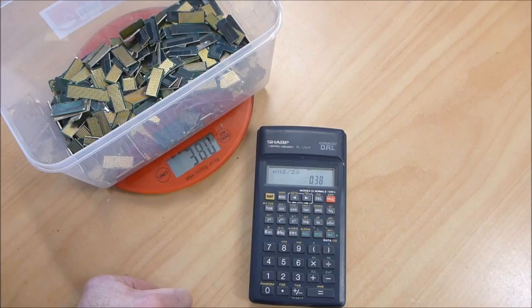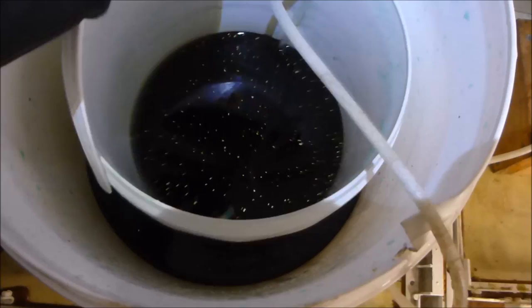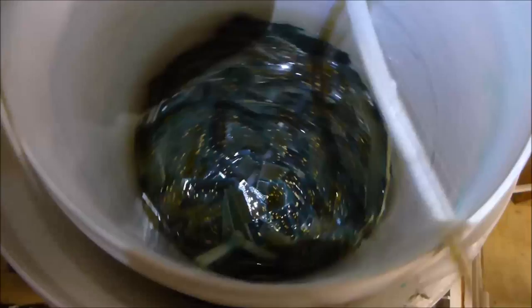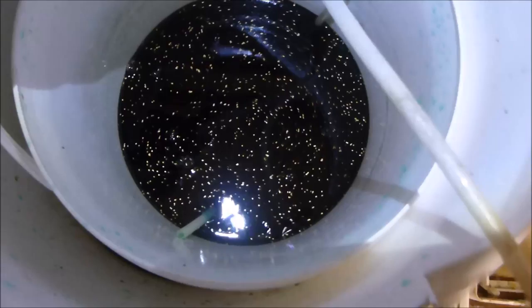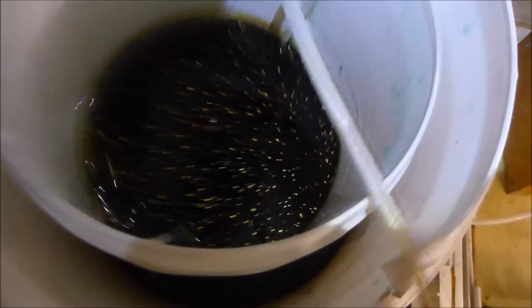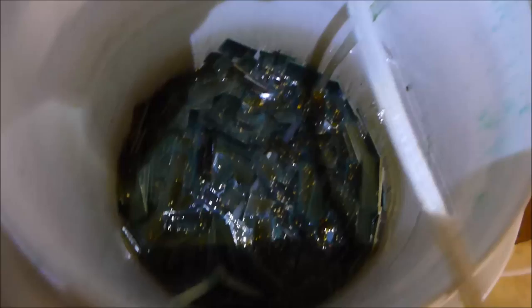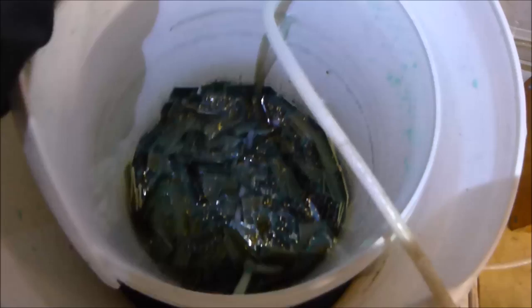I've had the bottoms from the pinless processors sitting in an AP solution bubbling away for a few days. It appears that most of them have lost all of their foils. As you guys will see, quite a lot of nice little bits of gold there. Those little foils do indeed come off as foils, so they are obviously relatively thick. I'm going to get this stuff filtered and the circuit boards washed off.